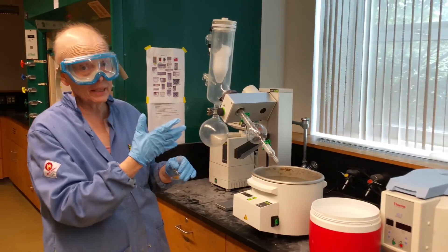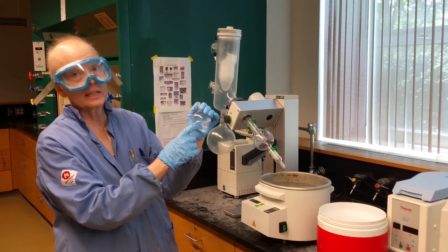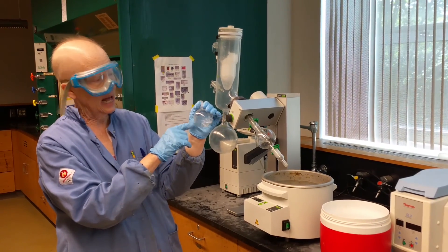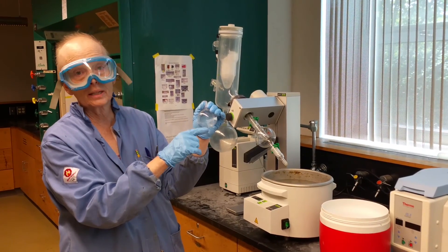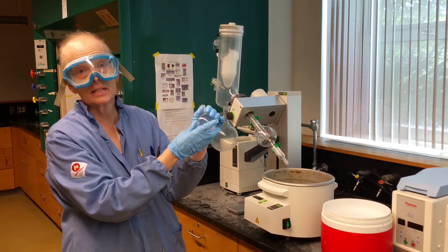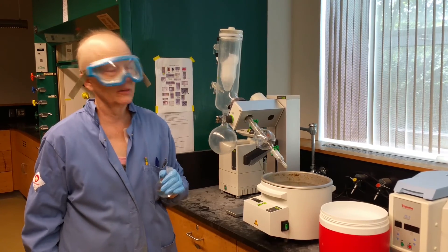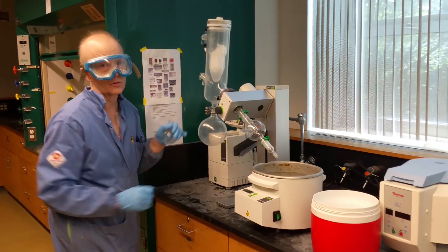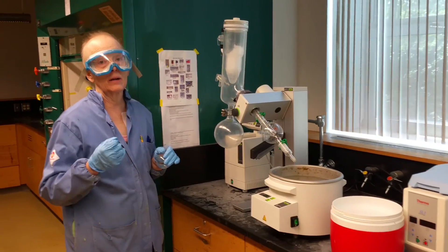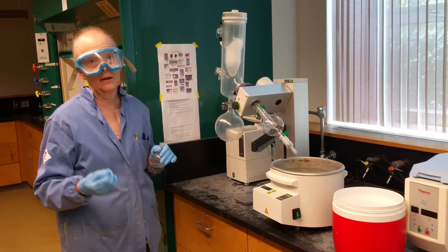But when do you use this? You use this typically when you're interested in isolating a solid or a very high boiling liquid that is dissolved in some solvent, and you just want to get rid of all the solvent very, very rapidly. So what do you do? You put it on the rotary evaporator.